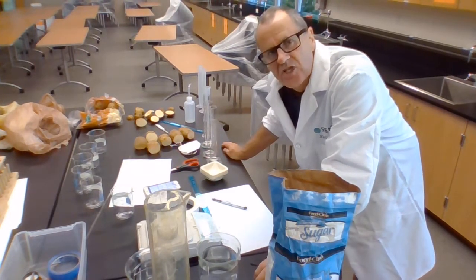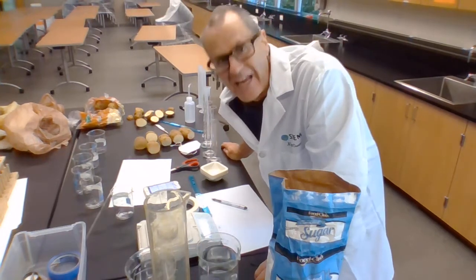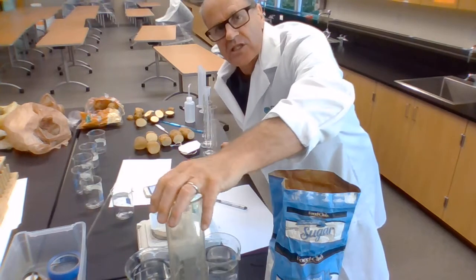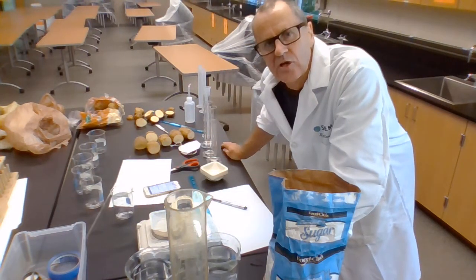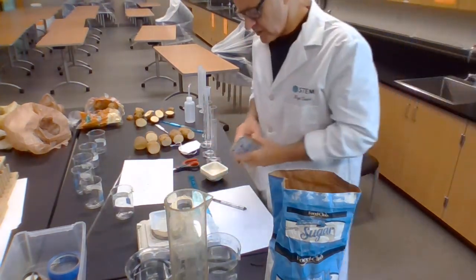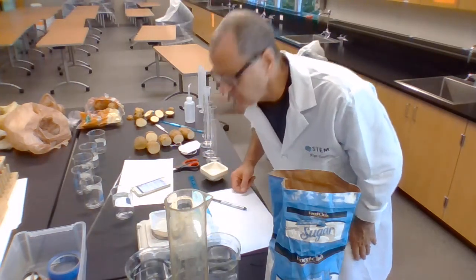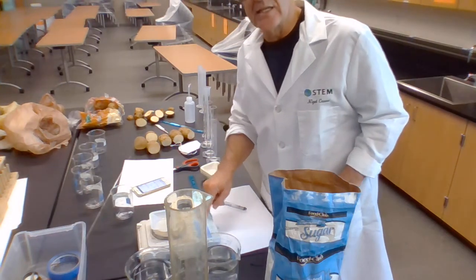I don't want a 1 molar solution of sucrose. It's too much. If I get 342 grams, that's almost a pound of sugar in a litre. It's difficult to get that much to dissolve. Instead of that, I'm going to take a 0.1 molar solution. So instead of 342.3, I'm going to find that divided by 10, 34.23 grams.